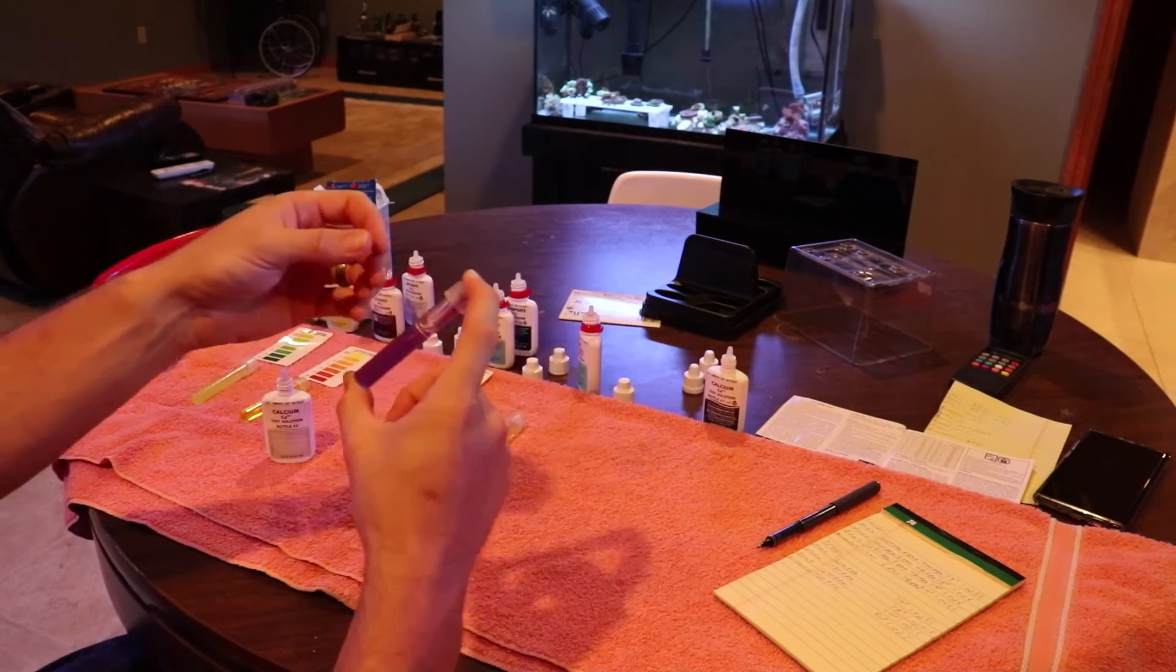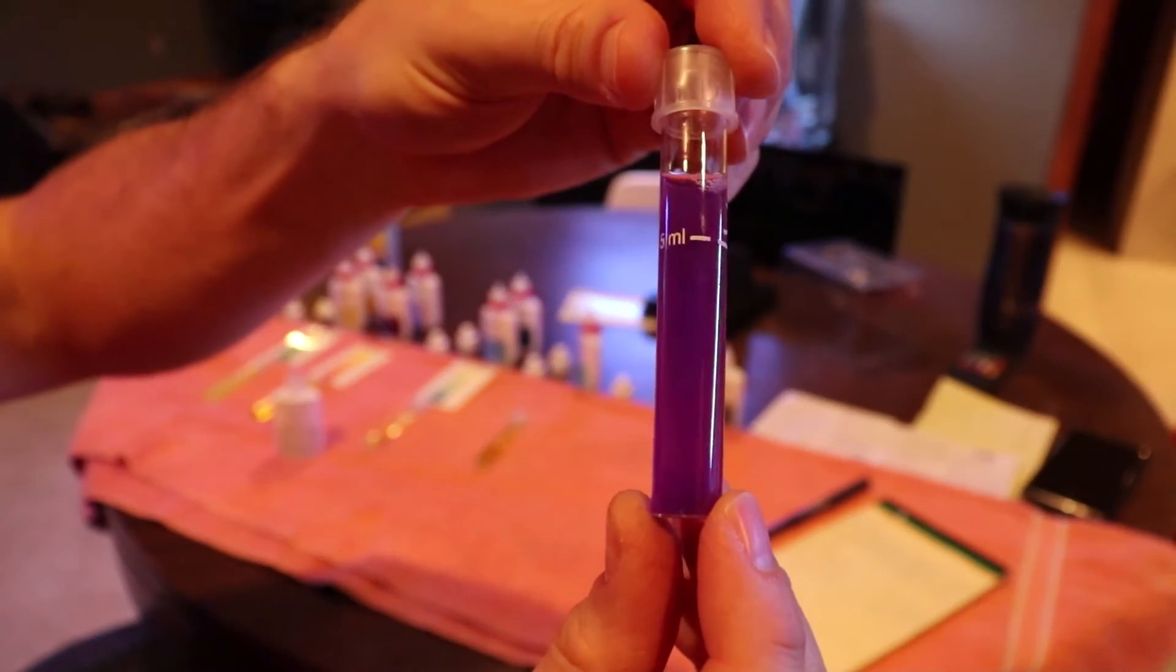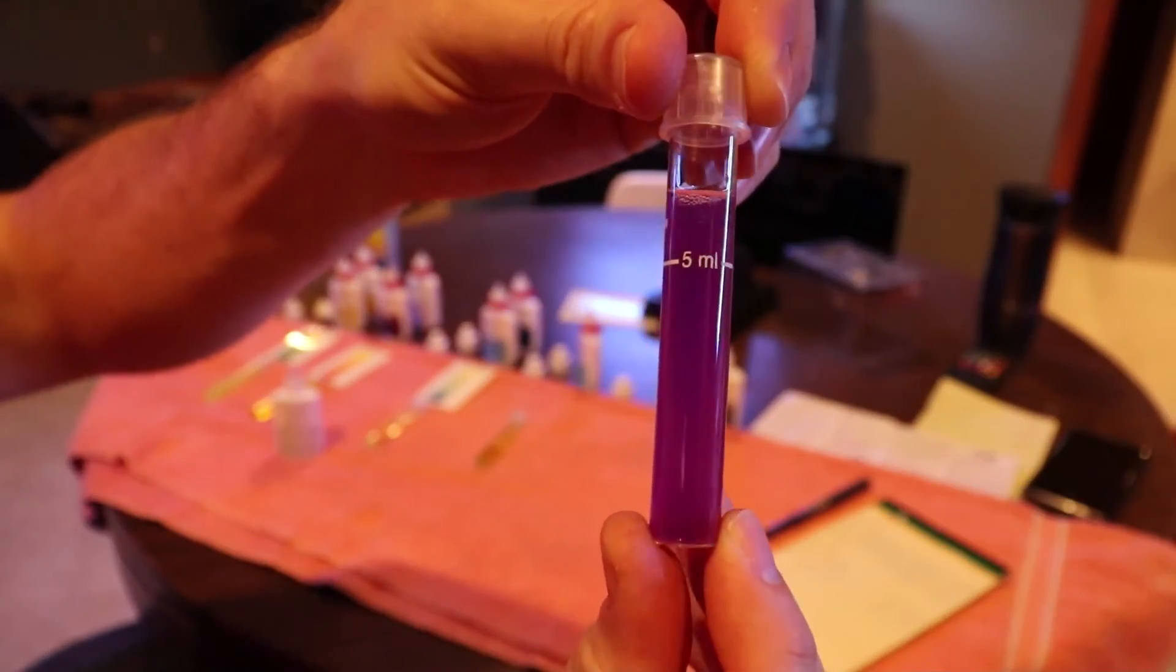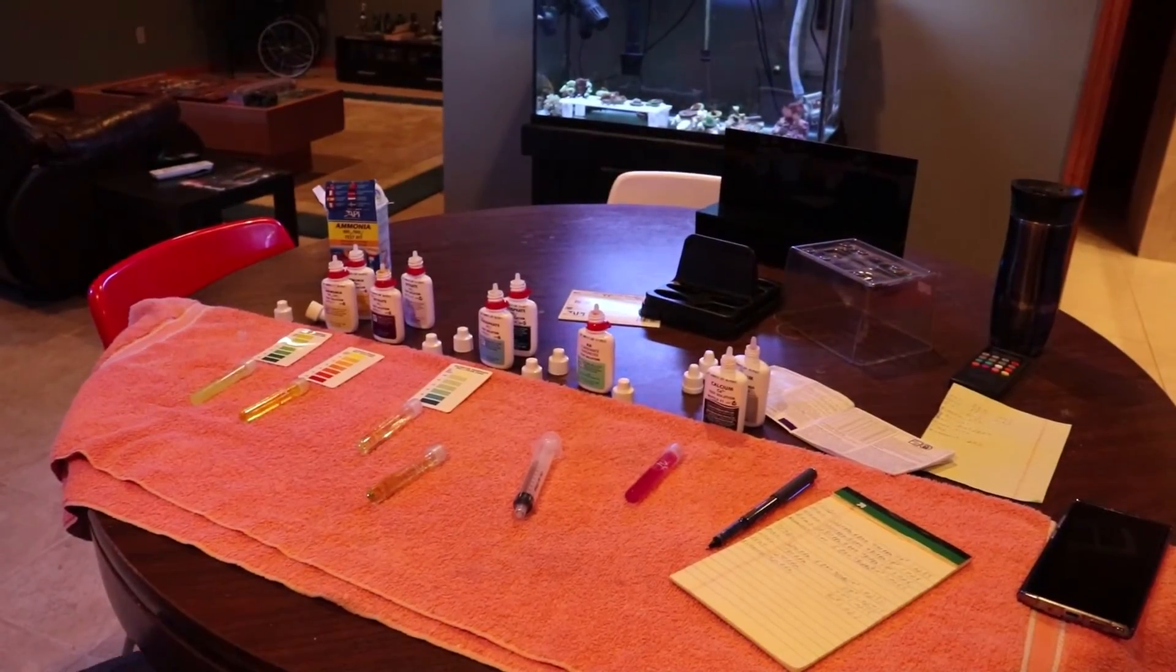I've heard a lot of people just trying to shoot for a number. You can see here the change to the purple color, so I'm going to stop the test and count.